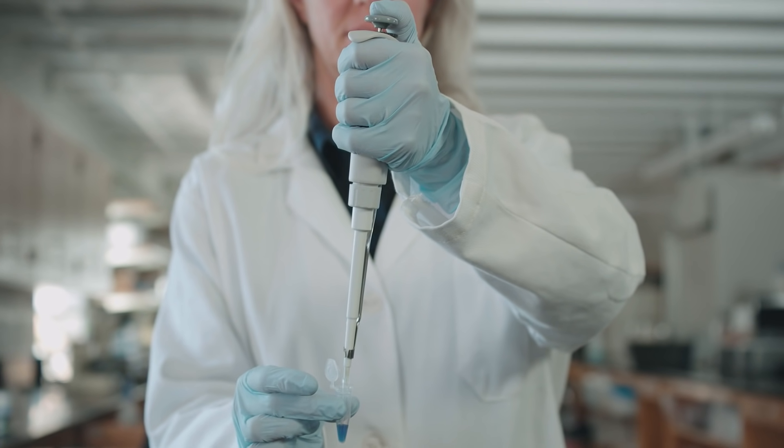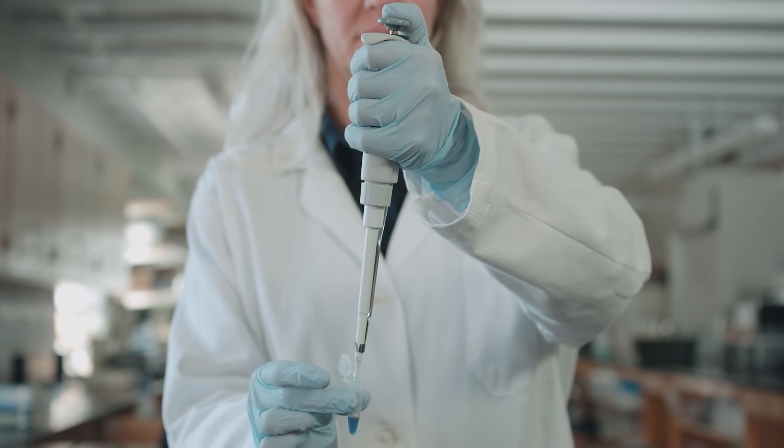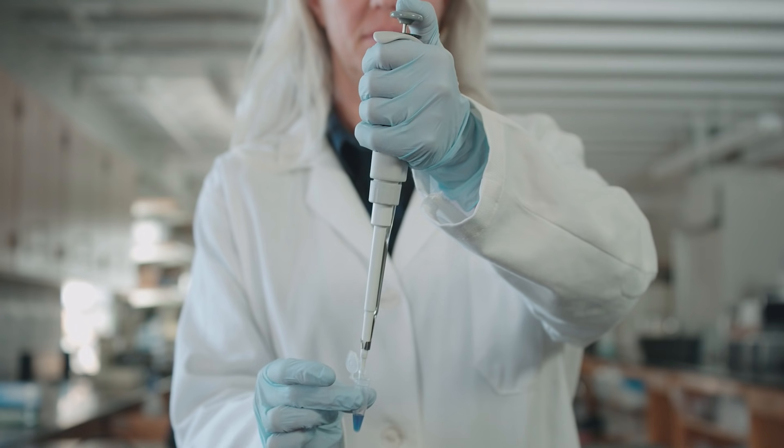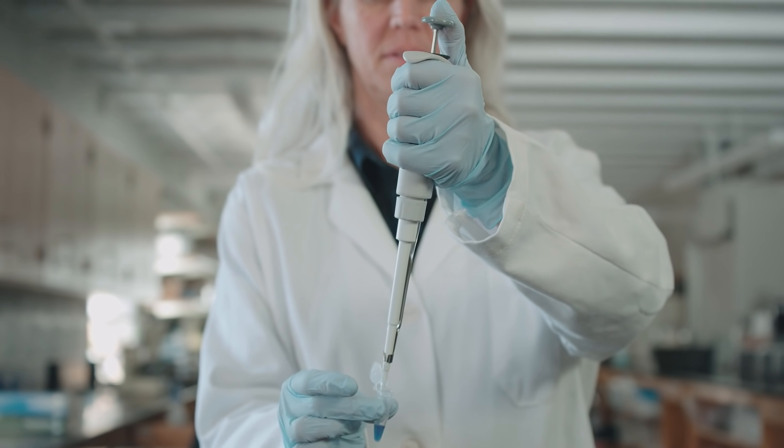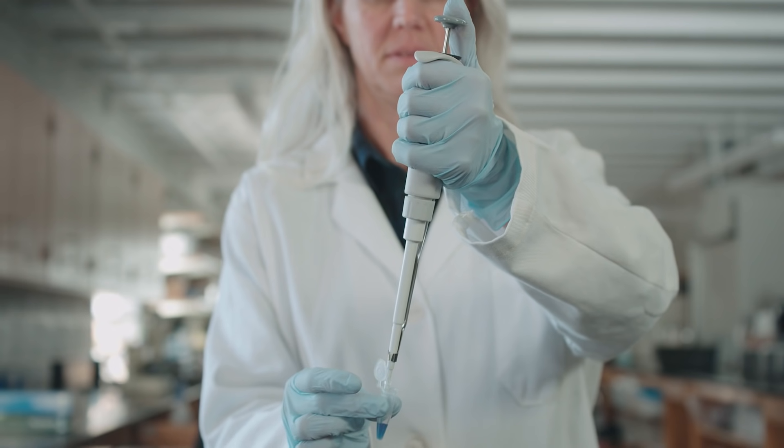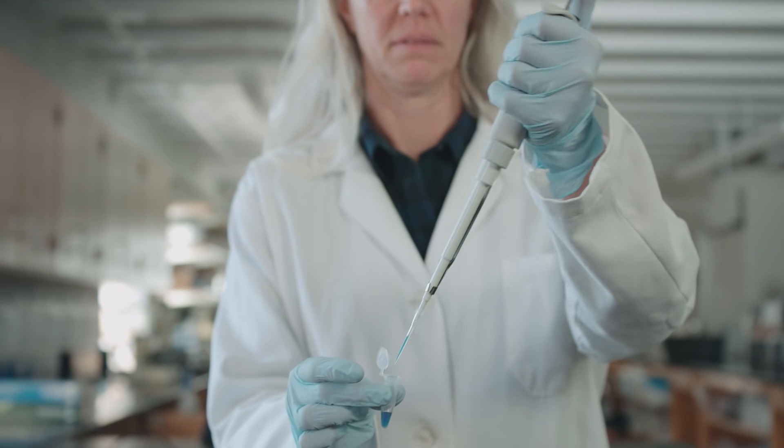Only the very end of the pipette tip needs to be placed into the fluid. To draw the fluid up into the pipette, slowly release the button. Make sure that you keep the pipette tip in the fluid until the plunger has completely regained its original position.